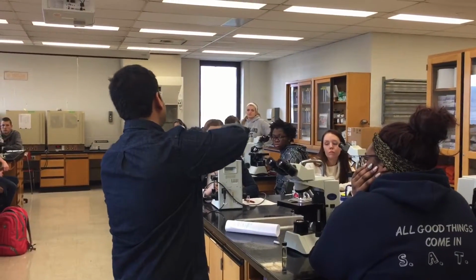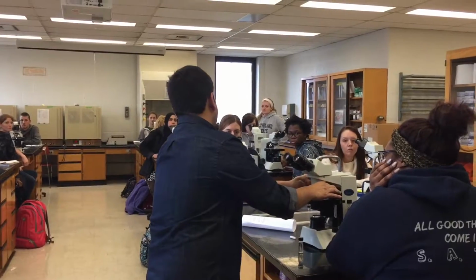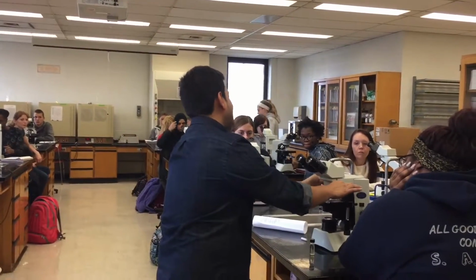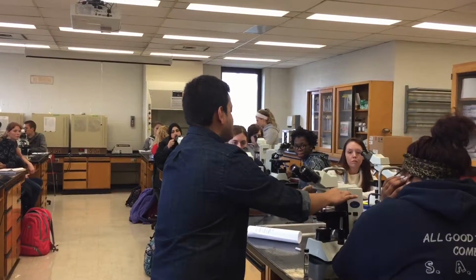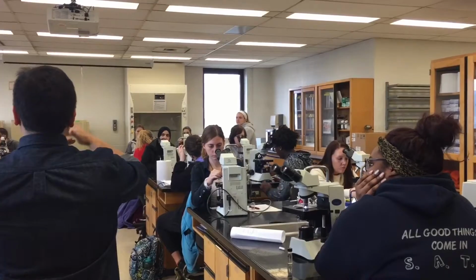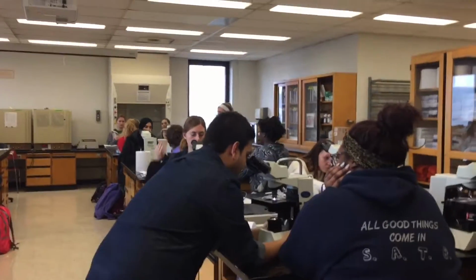So if I try to move it, it will pick up the oil from the slide. So I'll move the other way where the red is. You understand what I mean? So I'll go from 10x to 4x and then to 100x. As I told you, the 100x lens should be touching the oil on top of the slide. Okay? So now I'm going to keep my eyes there and focus on it.